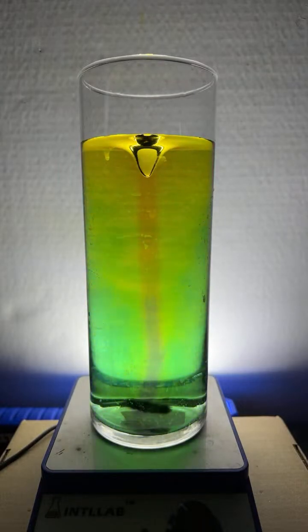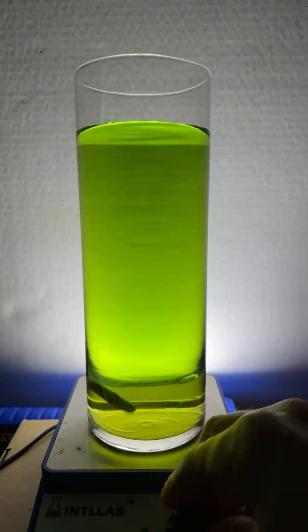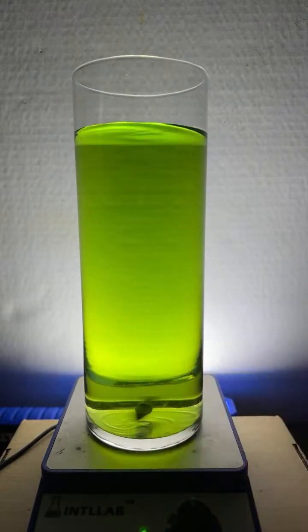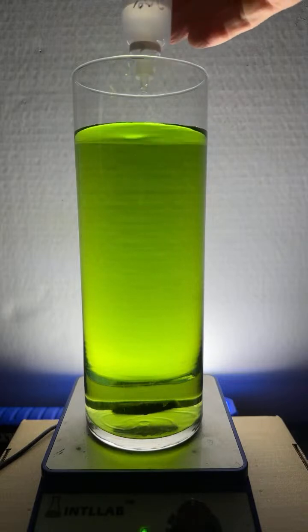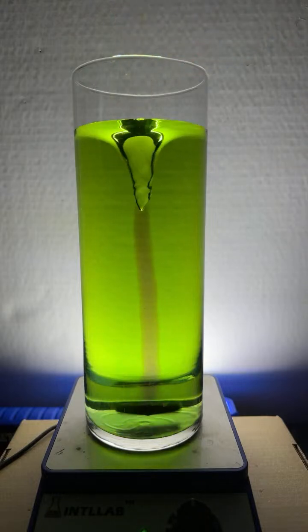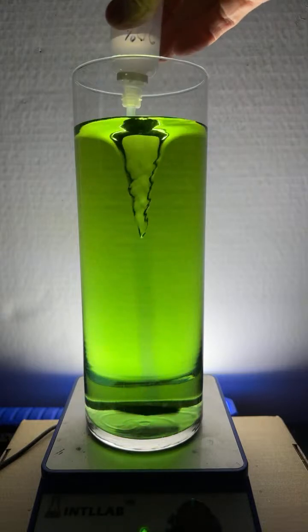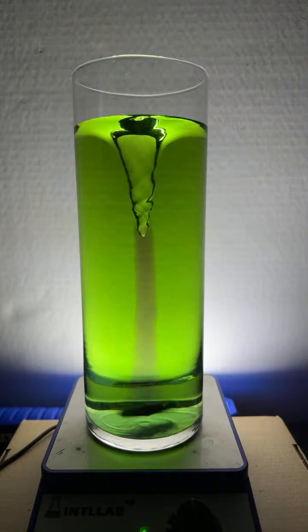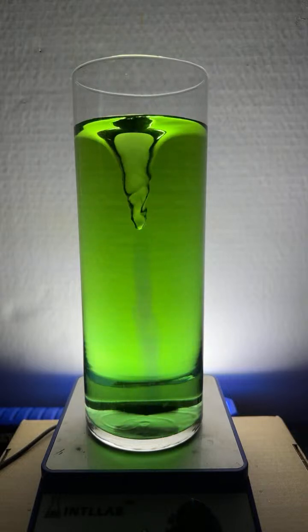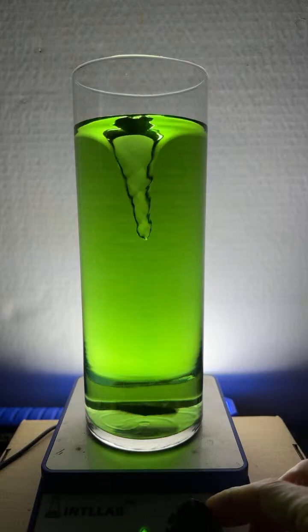Here, we'll try this. So this is the same type of system over here, but this one is buffered. So this is a buffered system. We'll get this one stirring. There we go. And check out what happens when I add base to this one. Now you see that violet color develop, but in this case, the surrounding mixture doesn't turn violet. It kind of just stays green. So the solution is resisting changes in pH. The pH changes are not happening very quickly.